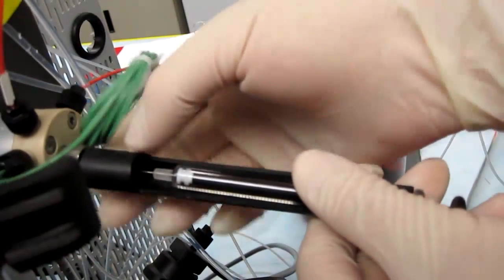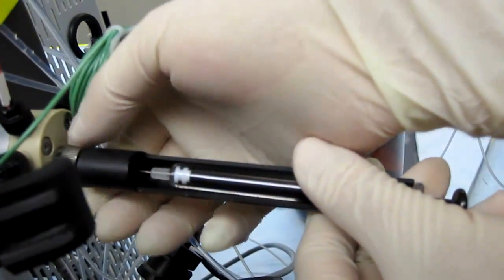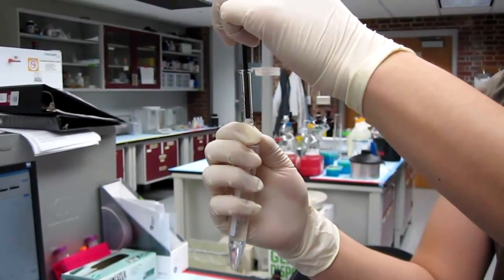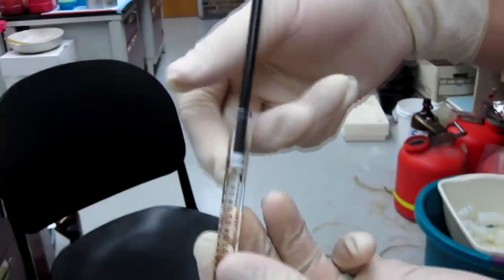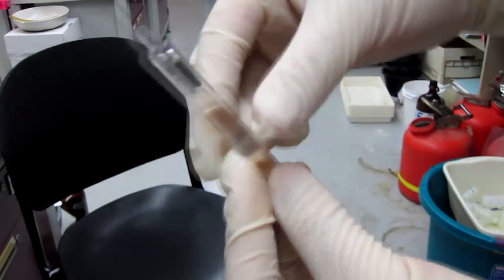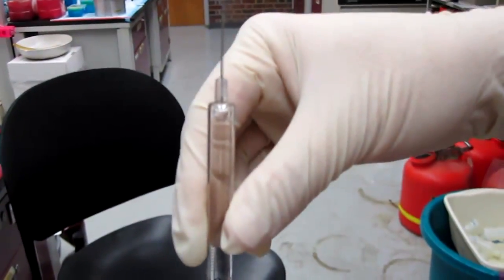Once executed, we can pull out the needle by unscrewing the metal cap. Now we can take up our sample. For this example, we used a 1 mil sample loop, and therefore a 1 mil syringe. If there are air bubbles in the syringe, we must flip the syringe and squeeze the bubbles out in order to prevent gas from entering the column.